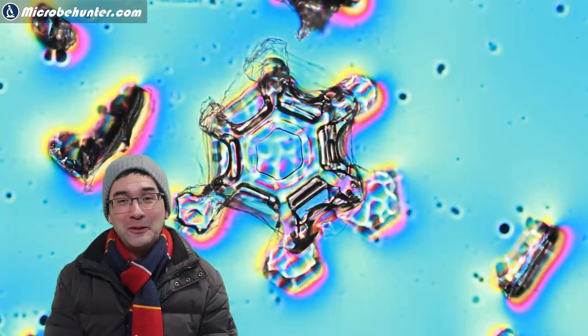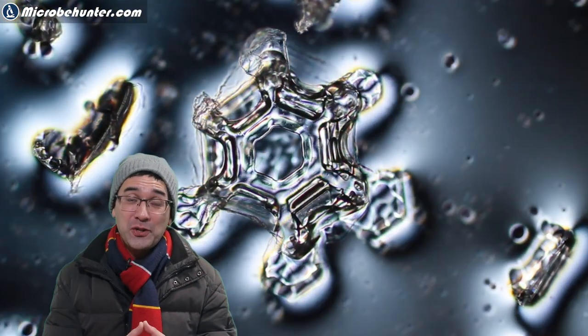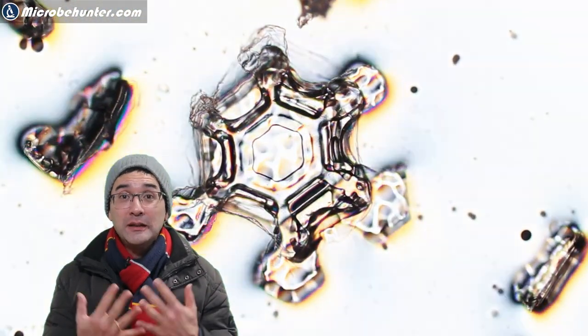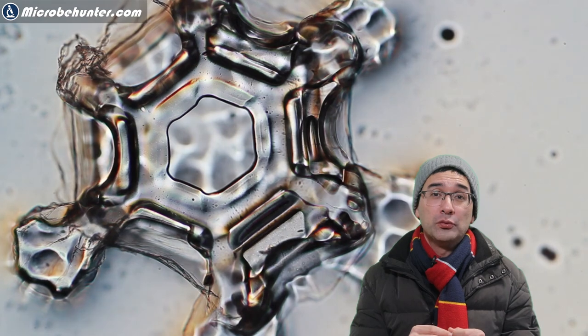So maybe you're going to be a little bit more lucky, but at least it shows you that the principle actually works. Now I did have to experiment a little bit around because what is important is that the thickness of the nail polish be right.